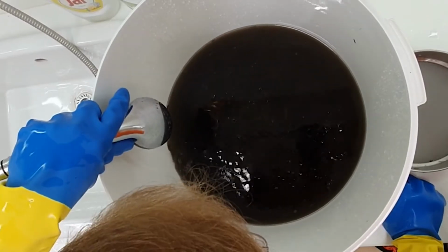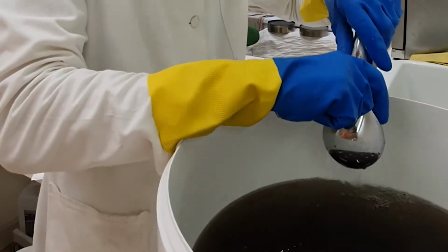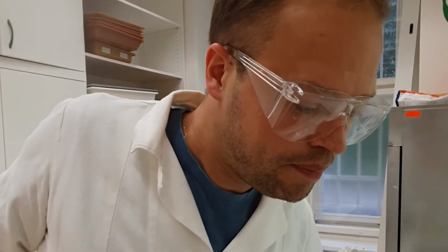If you would use warm water, many more things would float to the surface that you don't want to float. You can already see all the floating things like seeds are at the surface, but also maybe some other things that normally wouldn't immediately float are now floating to the surface together with the oil. When the bucket is almost full, you're going to turn off the water and leave it.